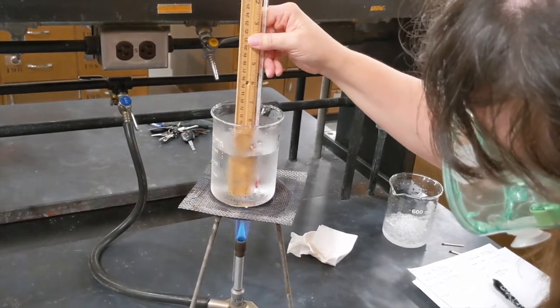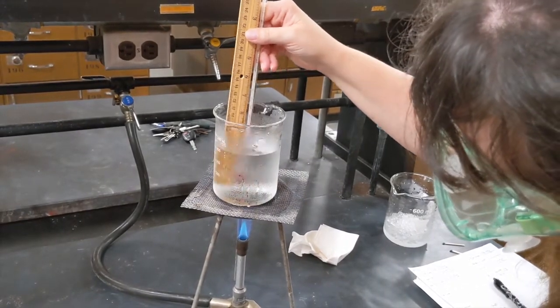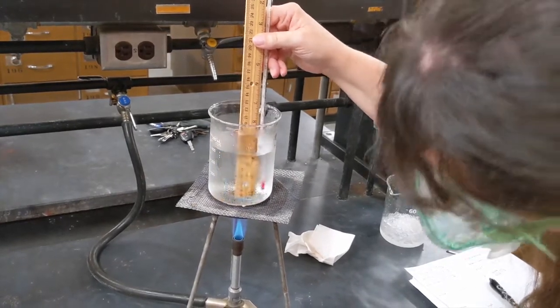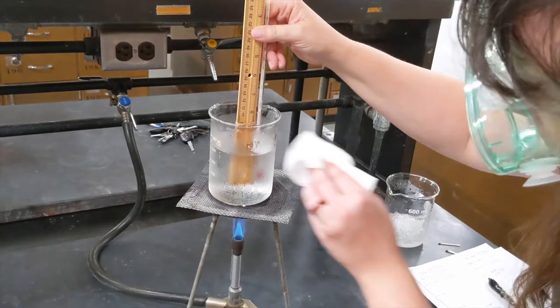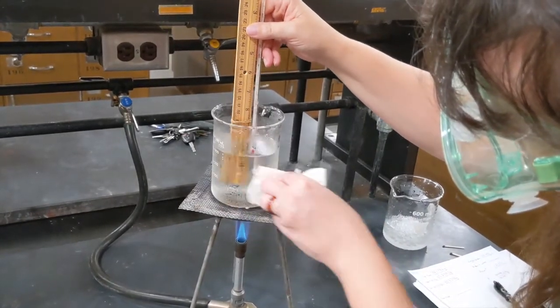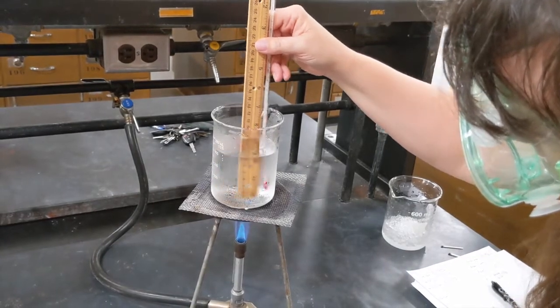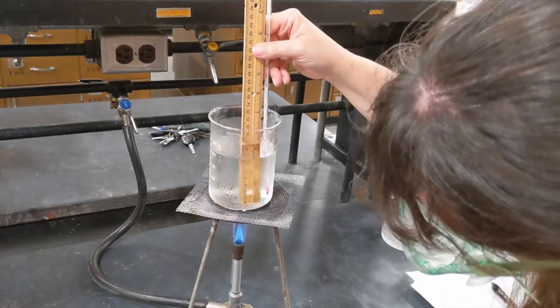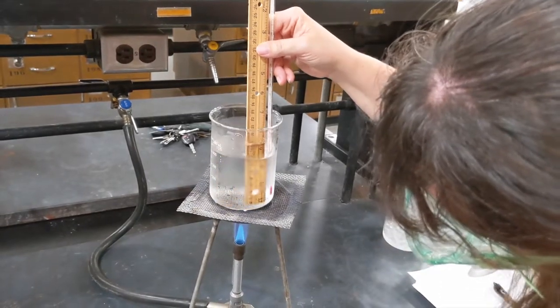To 5 degrees. In the early parts of this experiment, it's hard to see the numbers through the condensation. Later it gets hard to see as bubbles start to form and it starts to think about boiling.